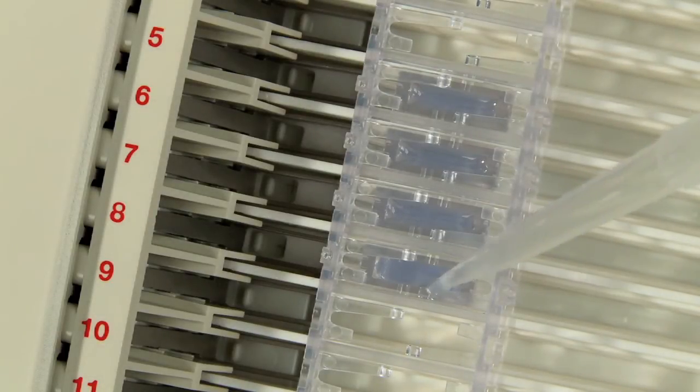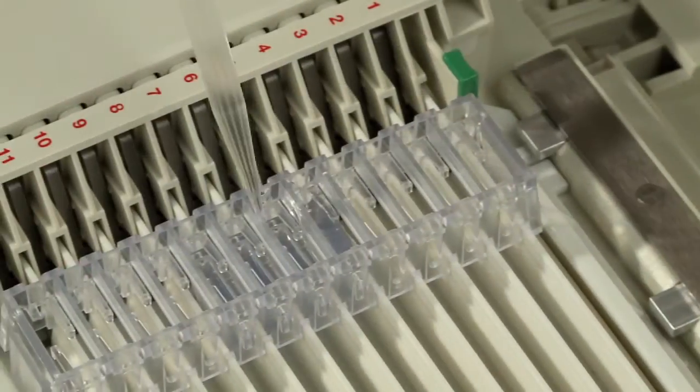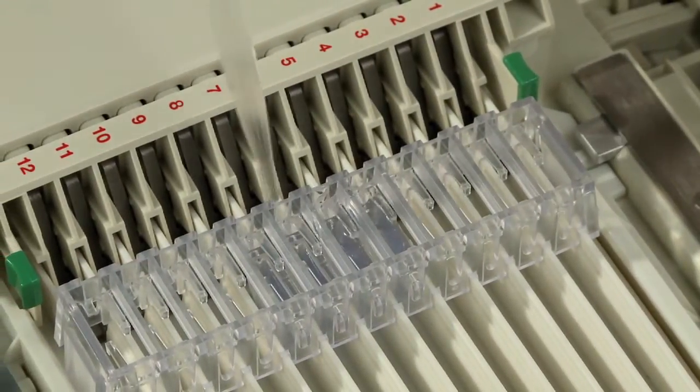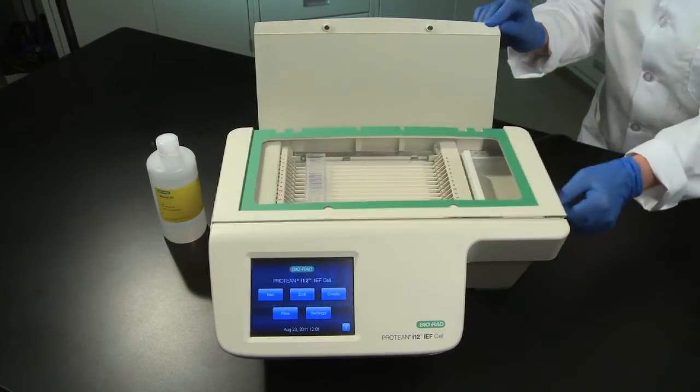Add the sample to the sample cup. Overlay the strips and the sample within the cups with mineral oil. Close the lid and you are now ready to program the cell.